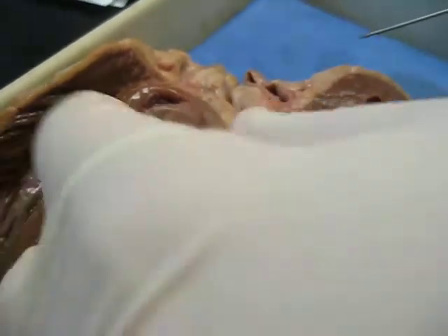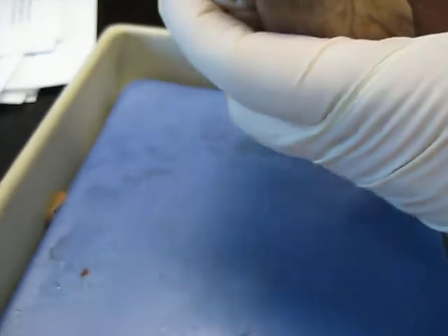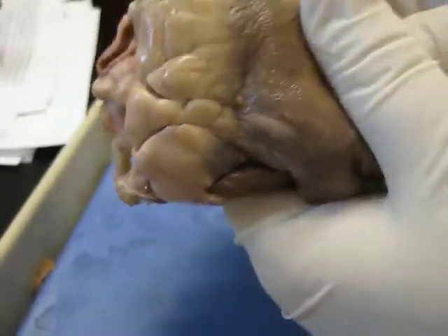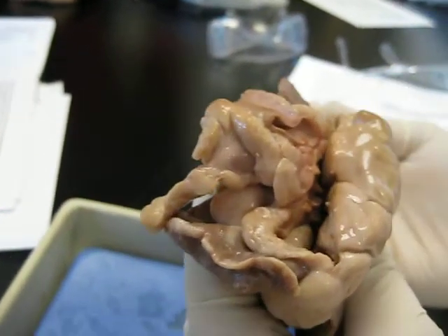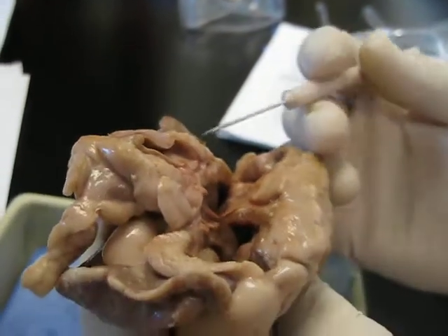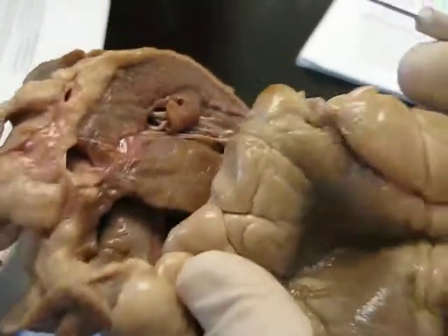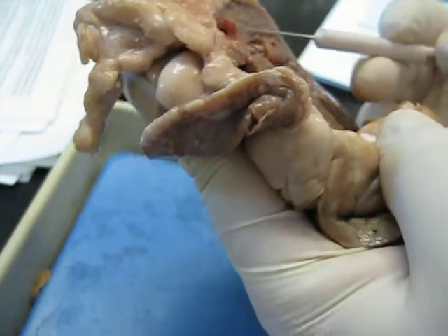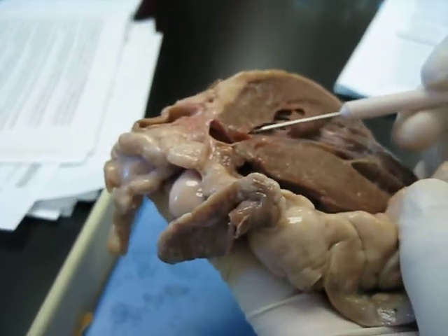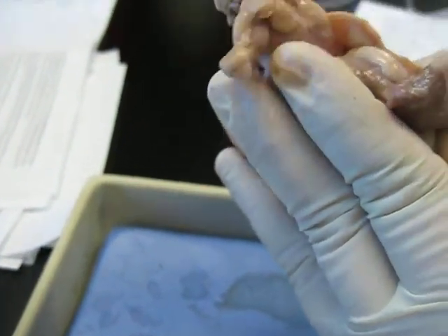Okay, let's see, let's get the vessels here. We talked about the 2 sulci. Take a look here. What's this little hanging over flap? It's the auricle. Right, and we have, auricle delphi. I know it's my favorite joke, but if we bring it up through here, you notice that if we go out from the left ventricle and follow it out, it goes past another valve. Going out this way, that's the aortic semilunar valve, passing out the aorta.